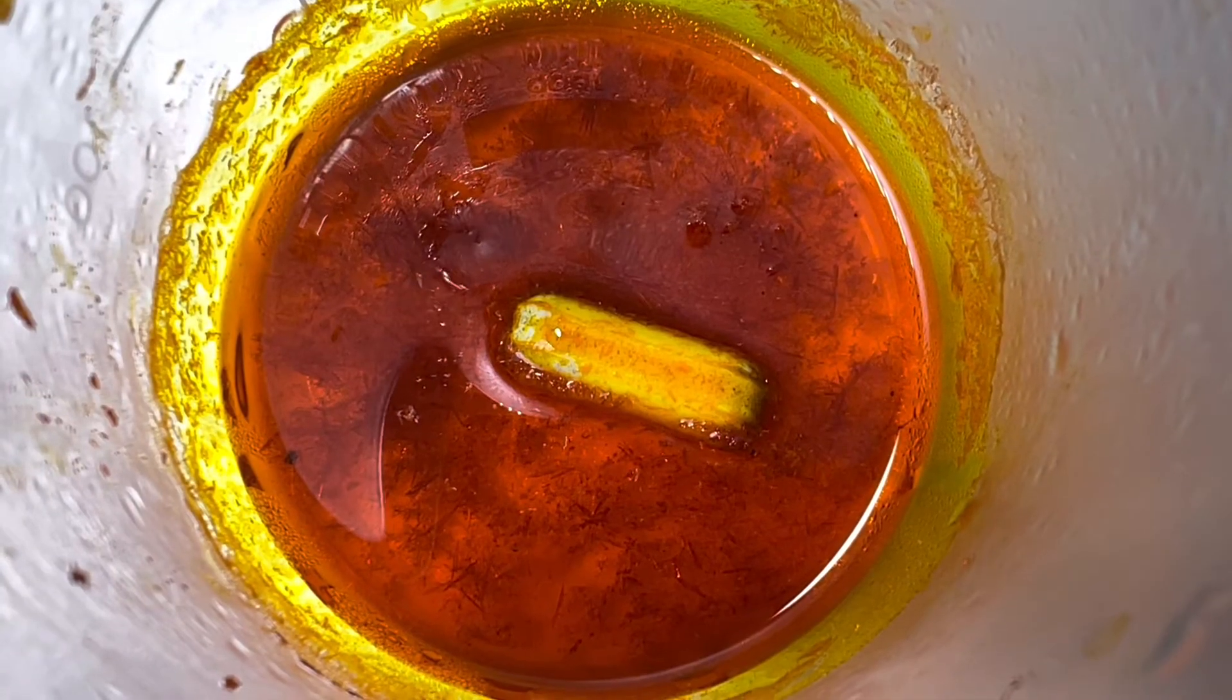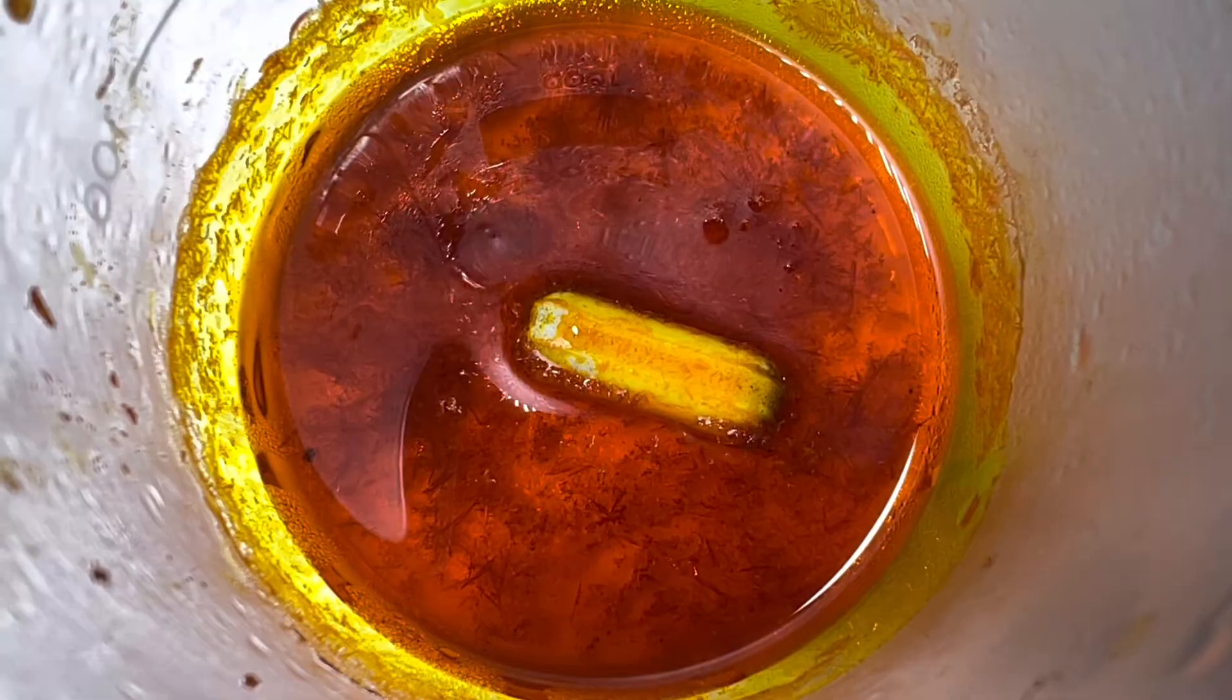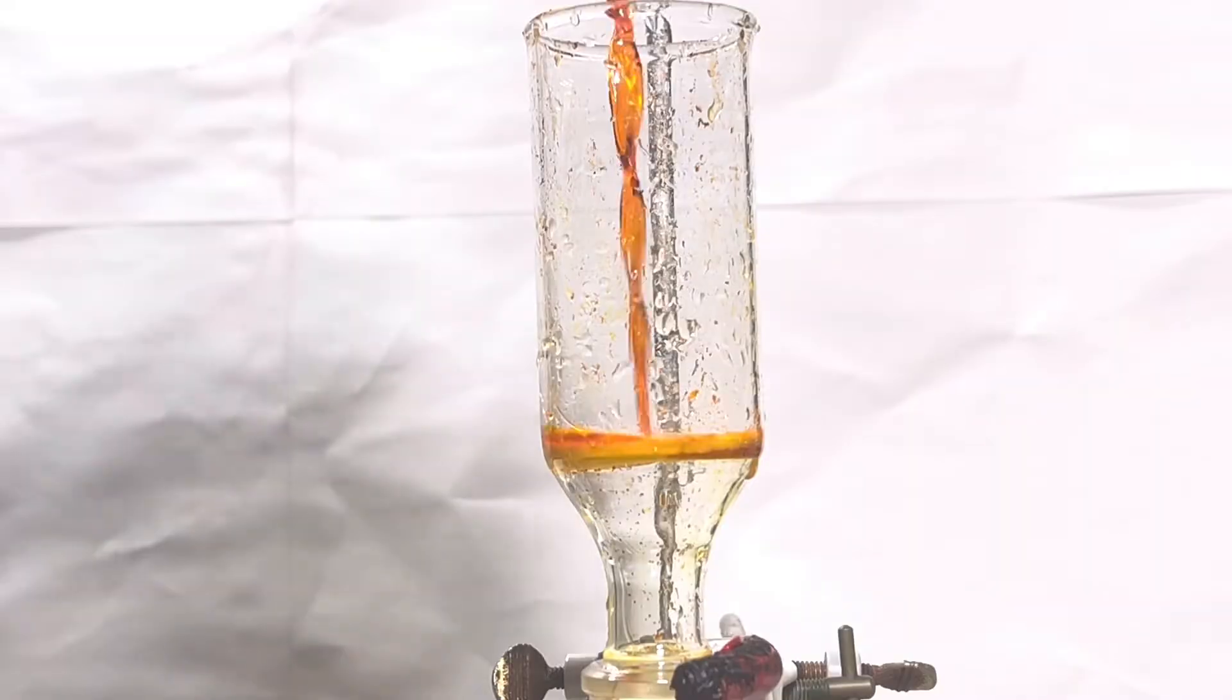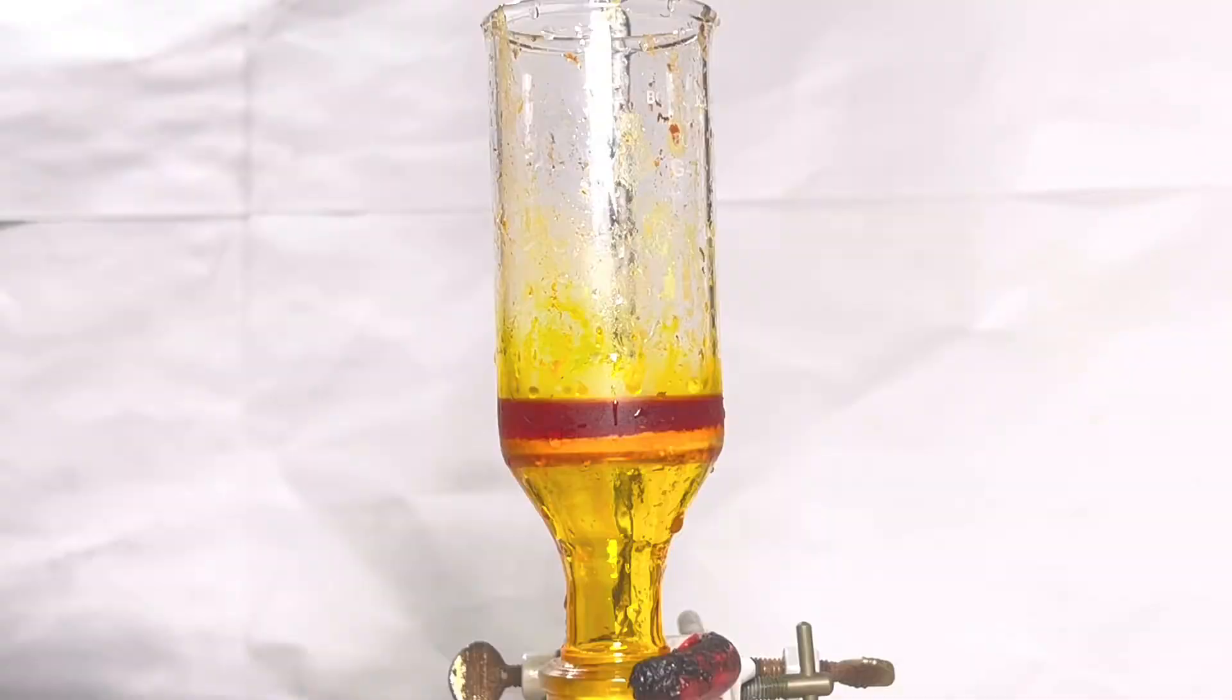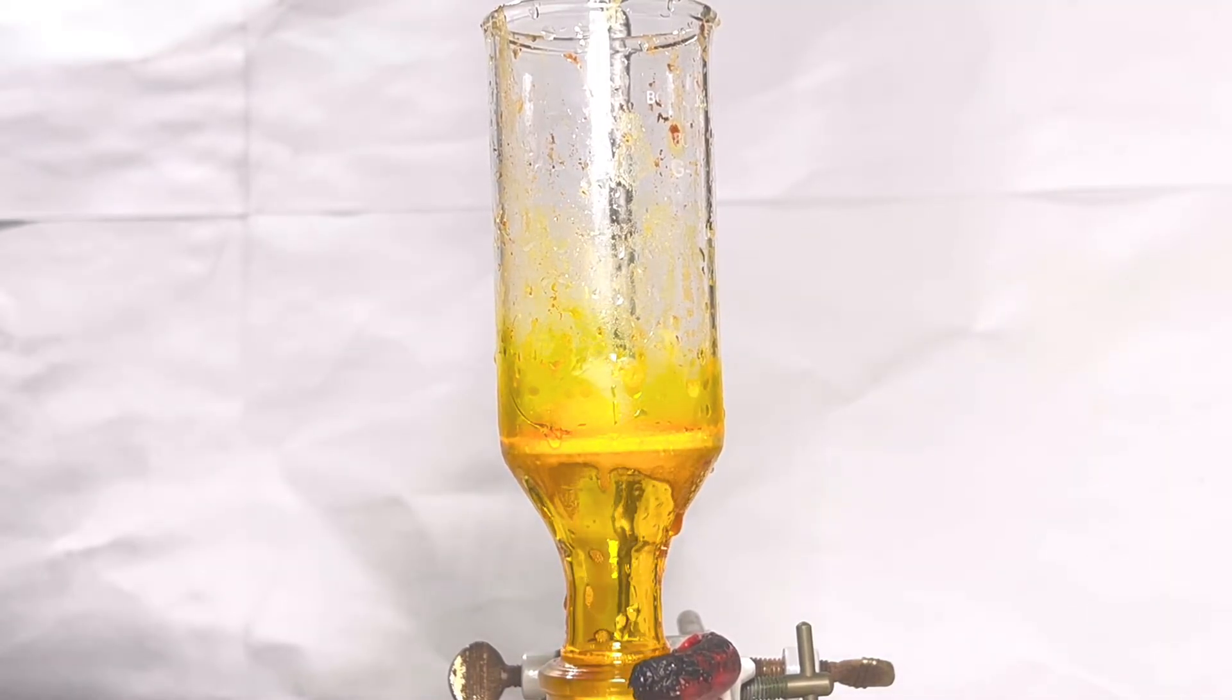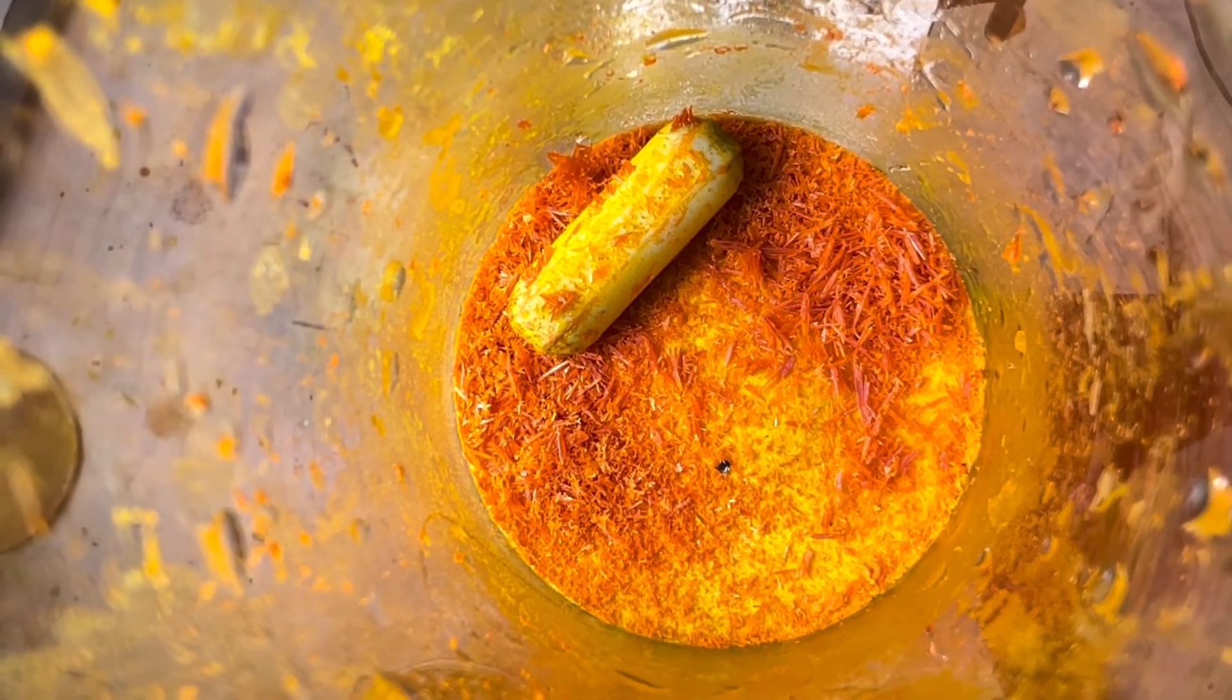On cooling, beautiful crystals of para-aminoazobenzene are formed, which are filtered and dried. This is the final product.